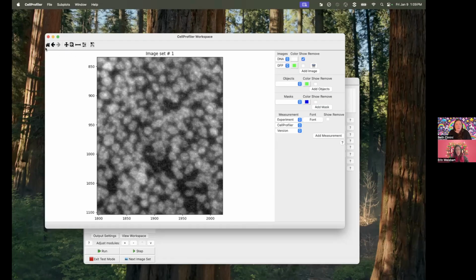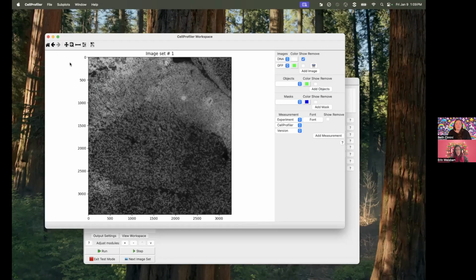The other thing you could think about, if you didn't want to do deep learning segmentation for whatever reason, maybe you're not comfortable, maybe your computer's really slow, is you could use a proxy metric. We often tell people, if you can't measure the exact thing you want, what's a close thing that you could measure that's easier to measure? So you could measure the percent of the image that's DAPI positive and GFP positive. Since each nucleus is about the same size, if what you care about is percent positive, the percent area positive should be very correlated with the percent number positive.